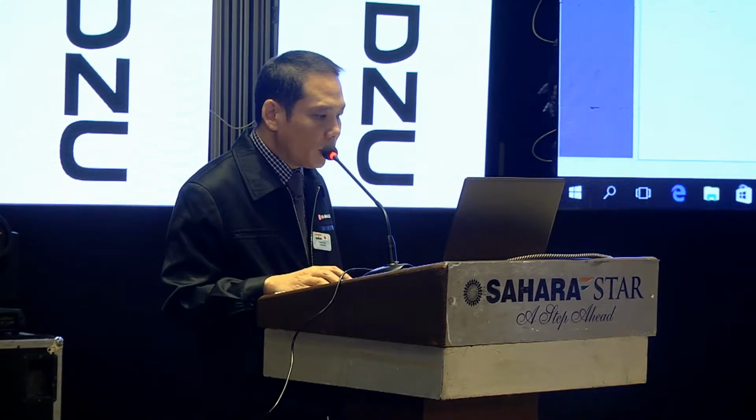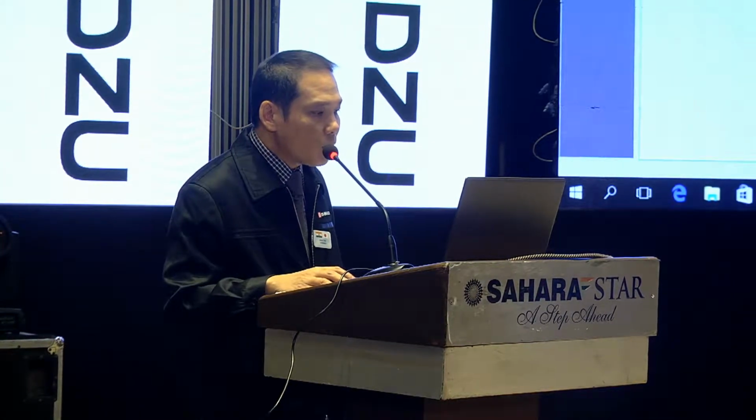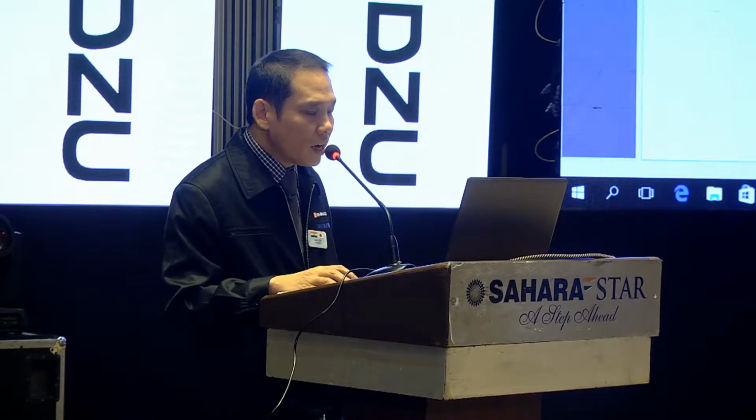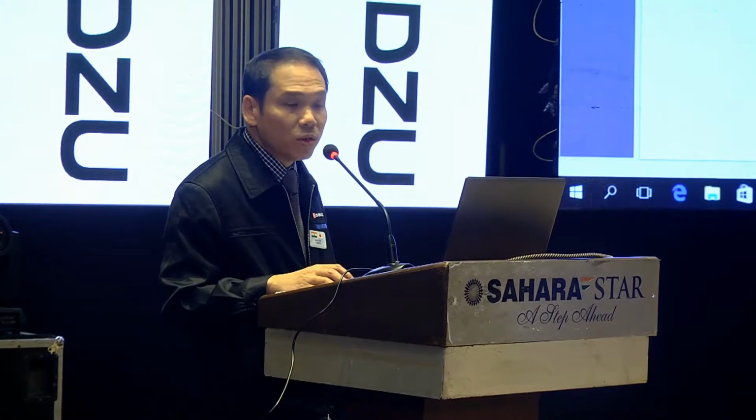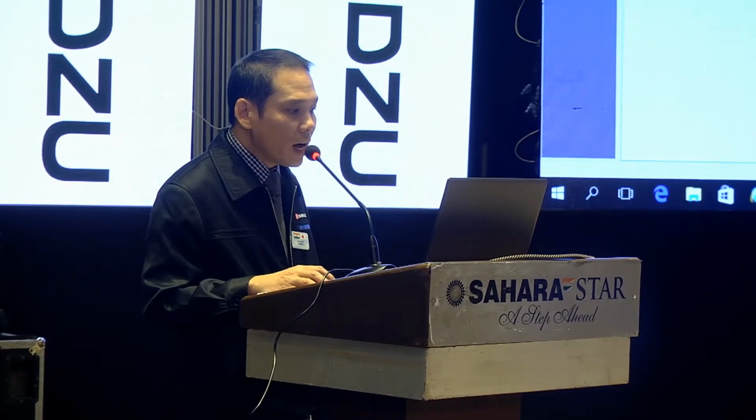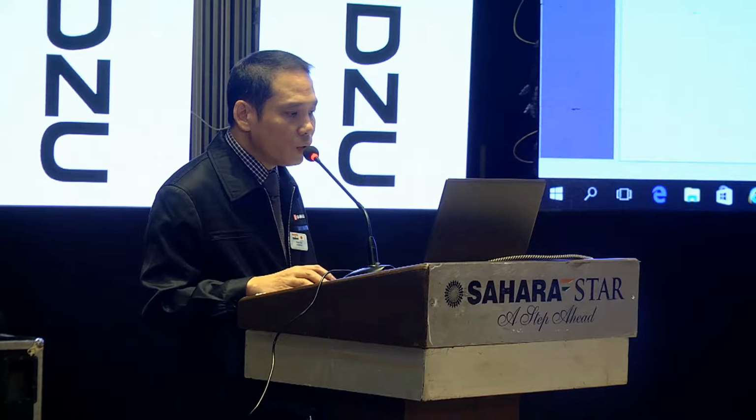Then you press OK. So you can assign this user as a system administrator or just a permit user administration. So I create this as a user, that's all.